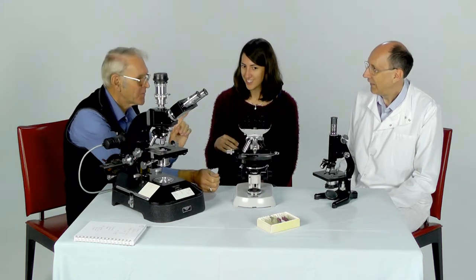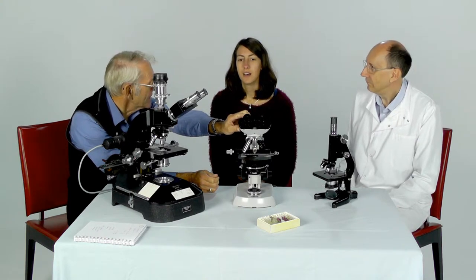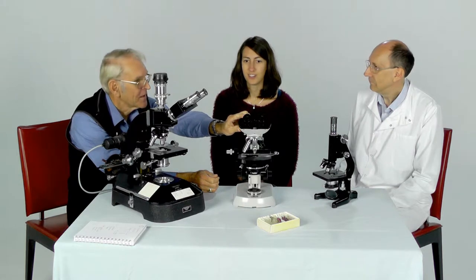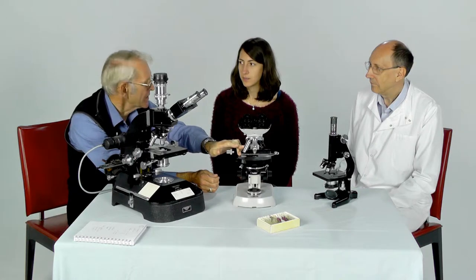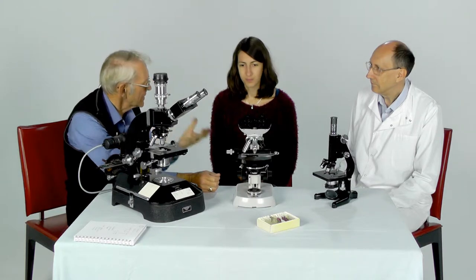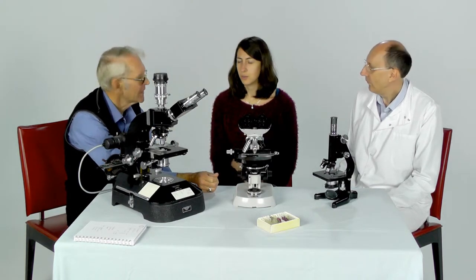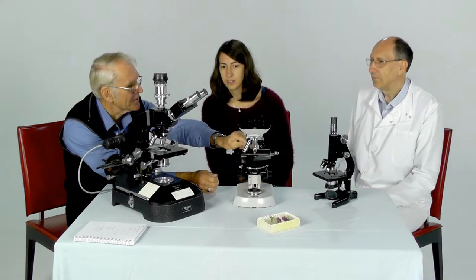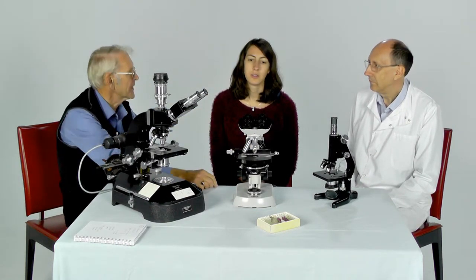Not quite, because you have to take account of the magnification that the eyepiece lens is providing as well. So they have magnification too. The eyepiece lens or lenses look at the image that the objective lens forms, and they magnify it a bit more, and modify it ready for reception by your eyes. To work out the total, you take the objective magnification and you multiply it by the eyepiece magnification.